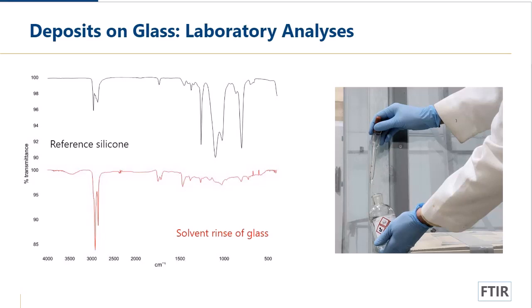In this case, each of these peaks is related to a given type of chemical bond. The main thing with FTIR spectroscopy is you can obtain reference libraries of hundreds of thousands of spectra. So you can match it to spectra to figure out what it is or figure out what it isn't. So in this case, the solvent rinse of the glass led to a little bit of detectable material. We know it's been outside. We know it's been exposed to a variety of different chemicals.